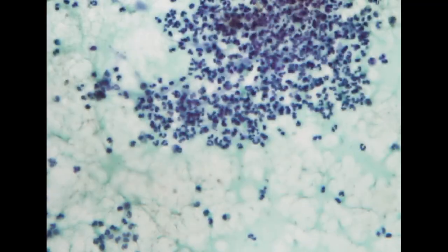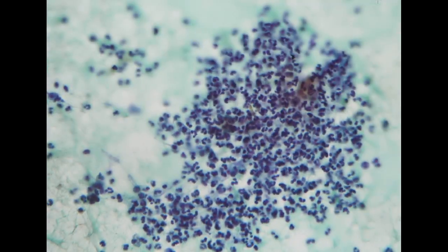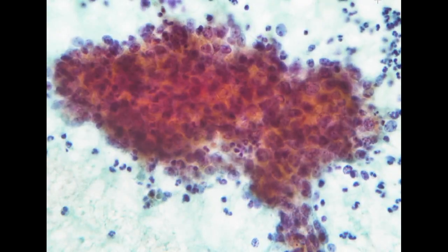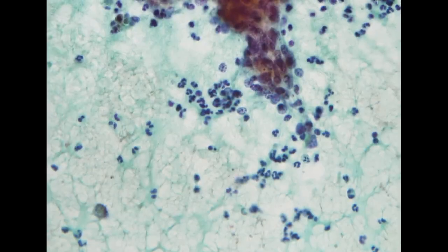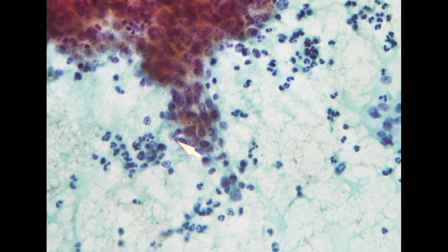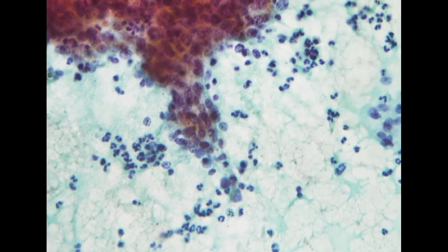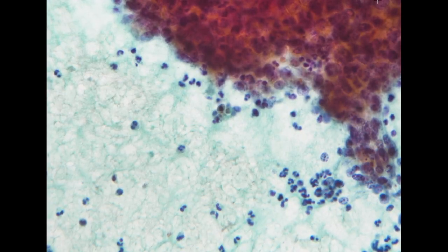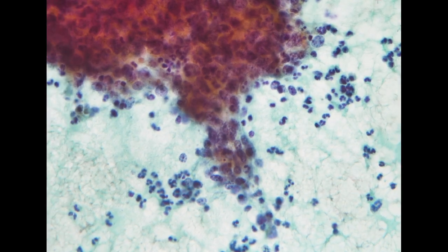So in the background, we see a lot of PMN, okay? And there are these tight clusters of cells. It looks quite degenerated. So at the periphery, you can appreciate that the chromatin is all beading, clumped together. I would say the cell is not particularly big. It is kind of small, so also compatible with marked degeneration.